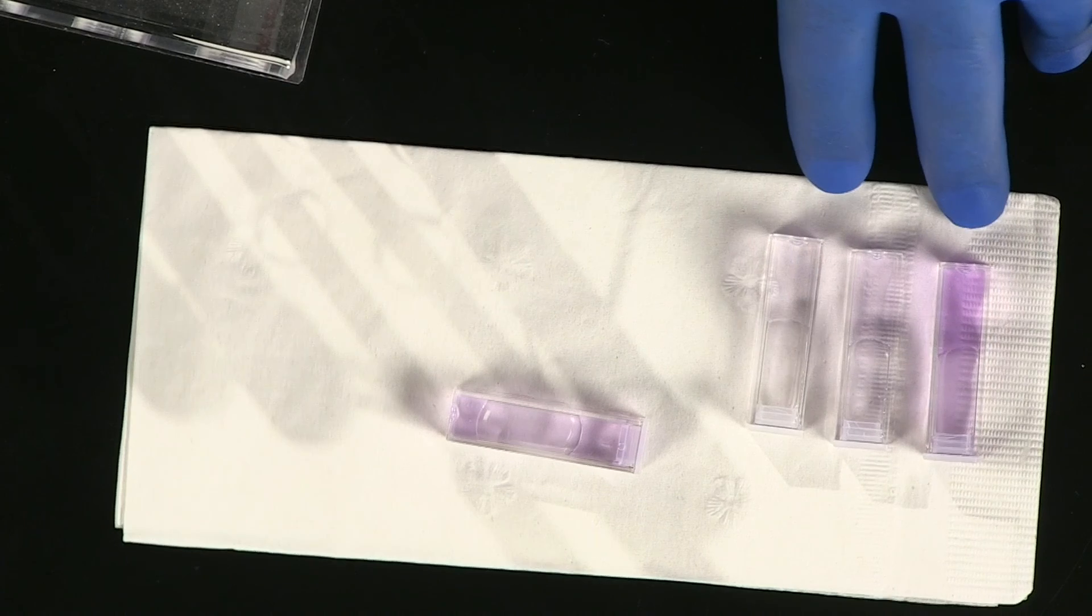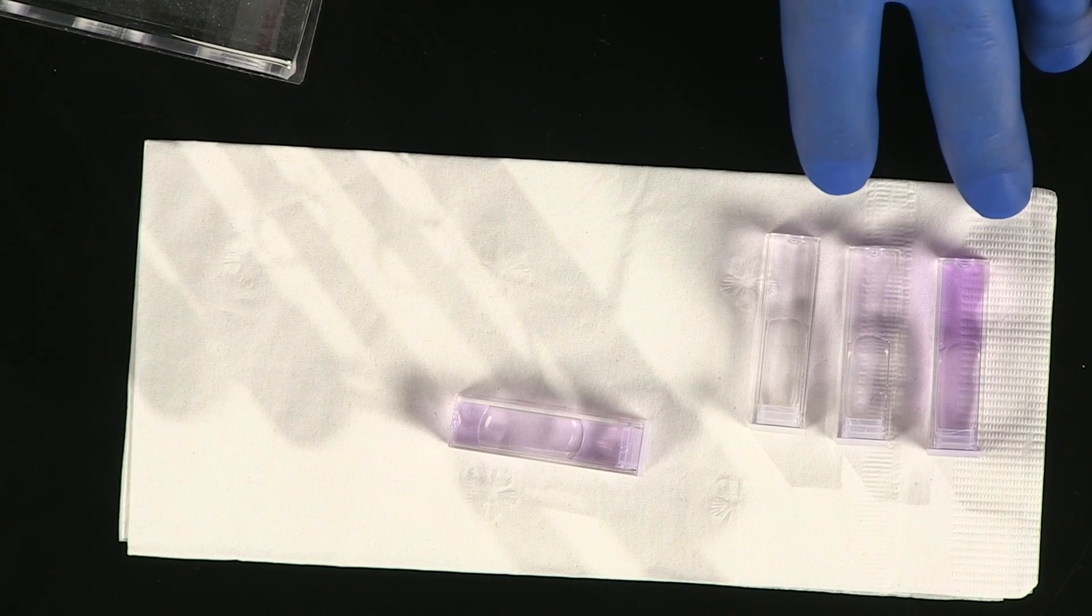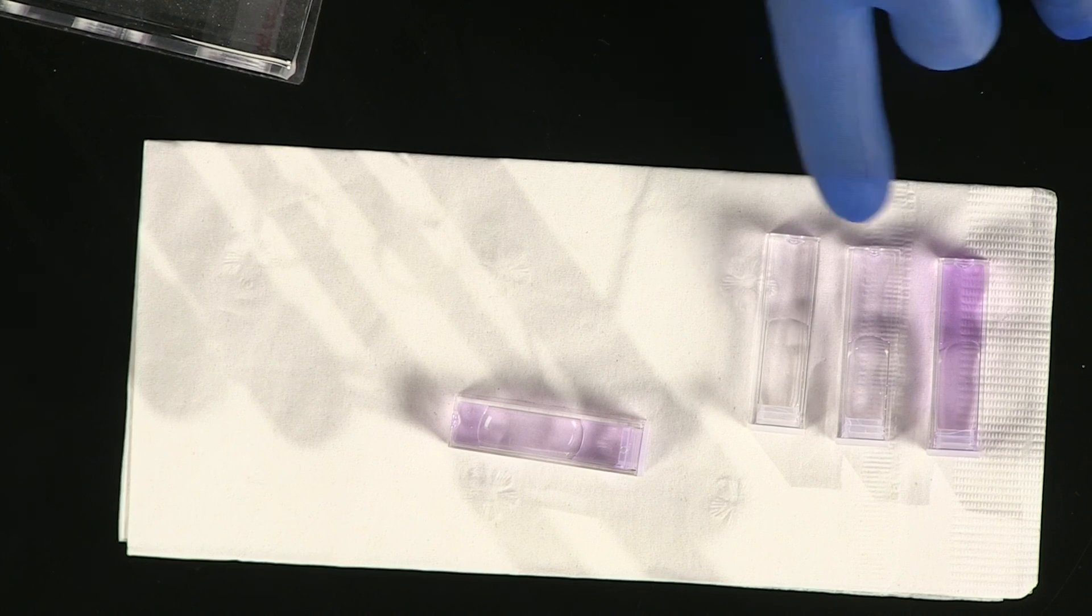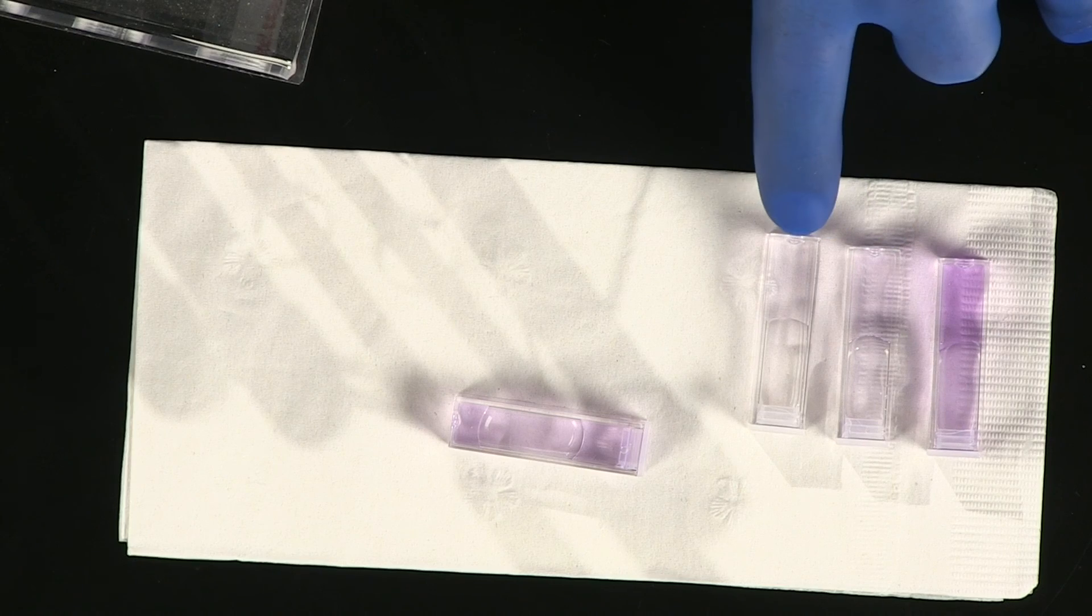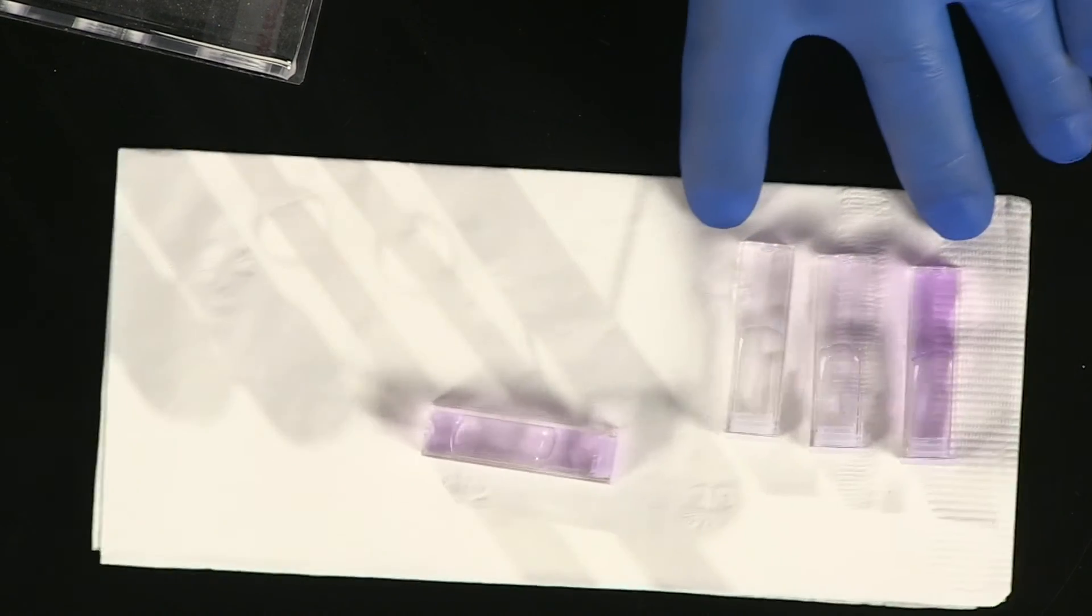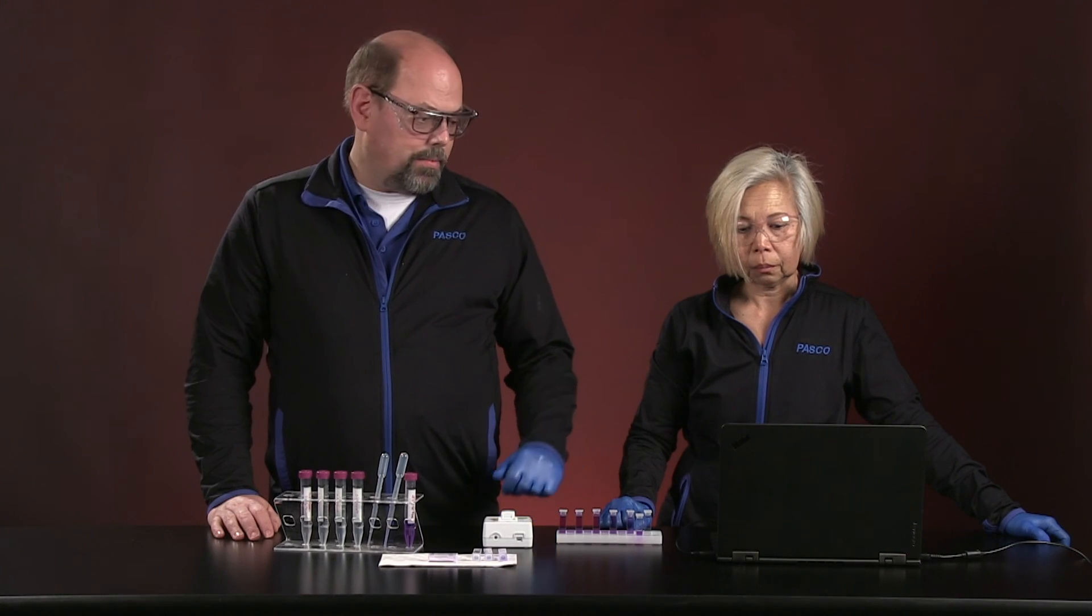Right. Visually, again, as she has mentioned, that the rate change is getting clearer faster or the steepest. You can see as we got more concentrated, this was the least concentrated solution. This is the medium concentrated solution. This is the most concentrated solution. You can see visually what that's ended up doing as I'm sitting here and while this is running and you're seeing happening on a graph.